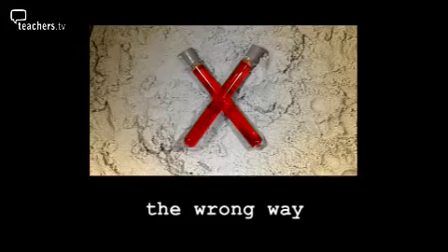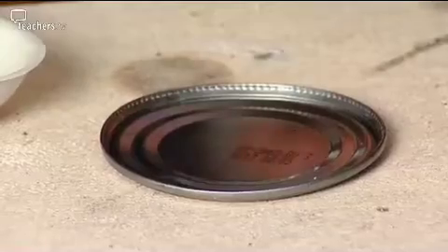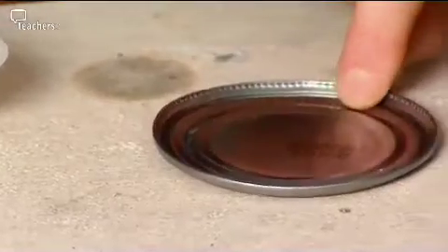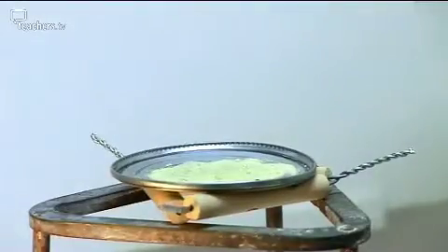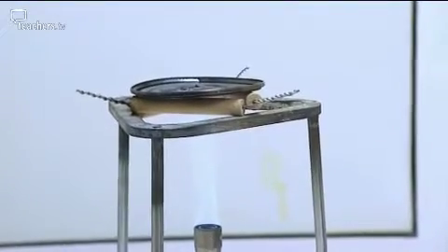So what has to happen now is we have to give them a bit of heat to get the reaction to go. And one of the major things that people do wrong is they think they can do it on a tin lid. And I think we ought to have a look at why you don't do it like that. So we're all set up in the fume cupboard. Iron sulphur mix on the tin lid. And all we need to do is get it hot with a blue flame and then see what happens.